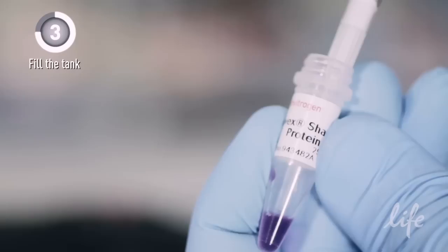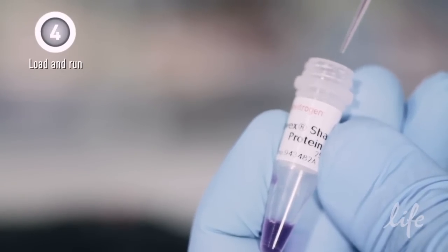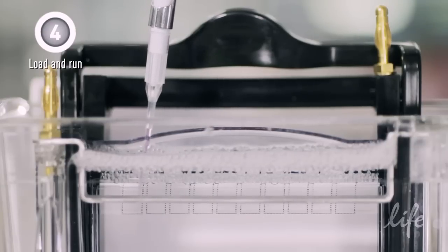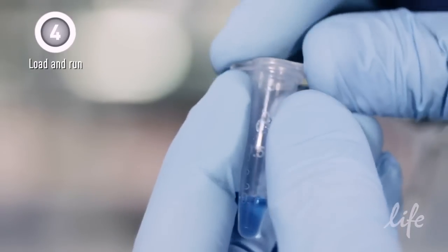Now you're ready to prepare your protein samples with appropriate sample buffer. The front loading wedge wells make it easy to load sample. Simply lower the pipette tip into the wedge well and pipette sample into the well.